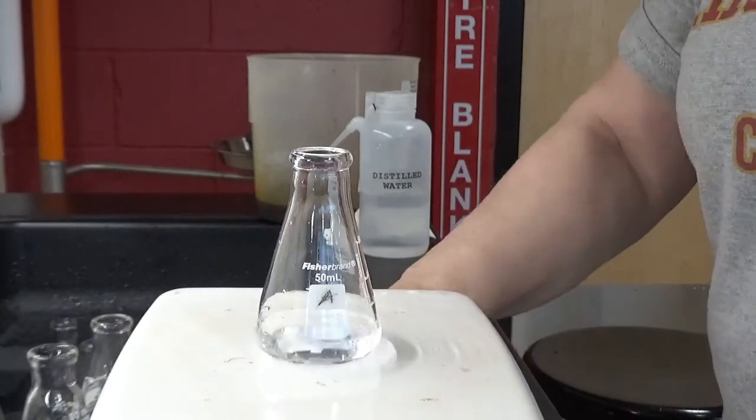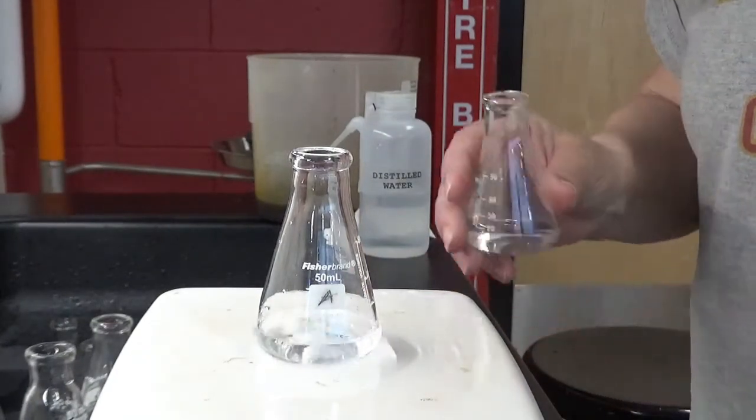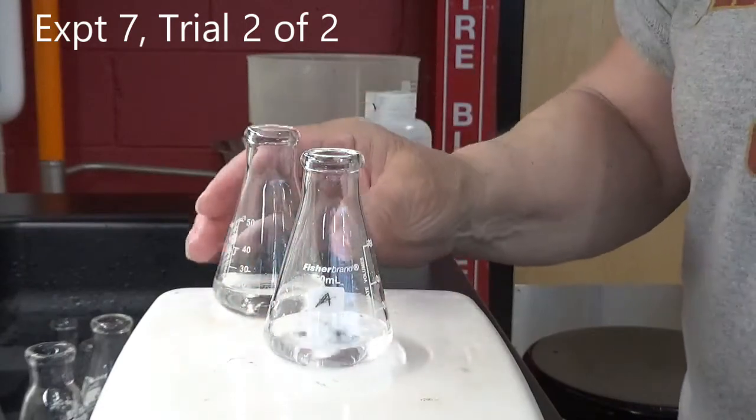This is trial number 2, solution A, solution B. Well, yeah. Run 7, right? Yep, for run number 7.